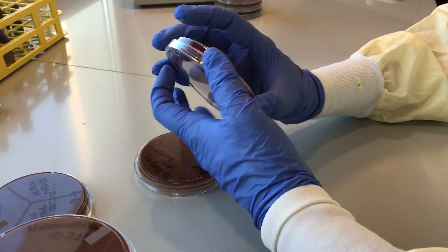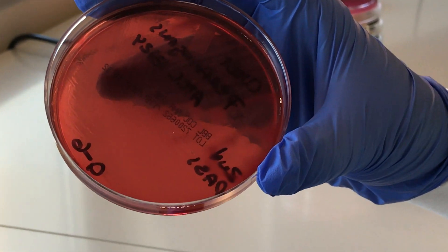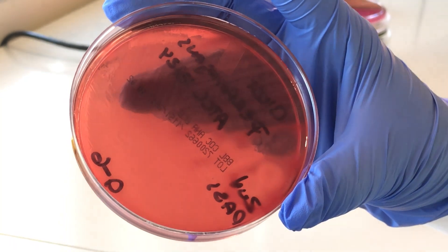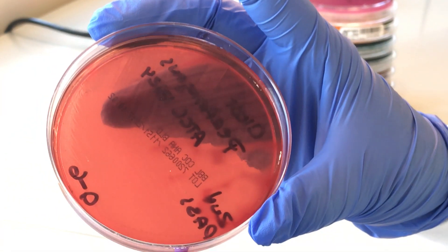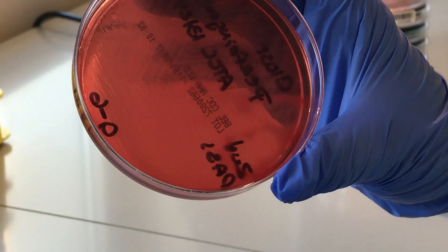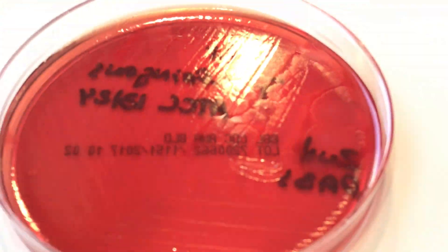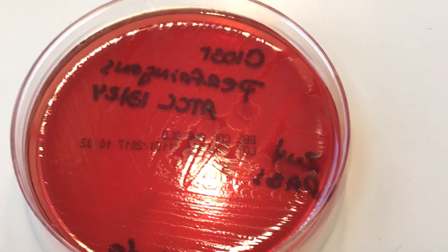Just for fun, some anaerobes. This is Clostridium perfringens. As you can see, it only grows anaerobically, so you can't have any oxygen in it. It's not facultative — it's an obligate anaerobe. And you can see it's really, really spready and beta. It's almost swarmy, but it's not swarmy. It's just really super spready and it stinks really bad.